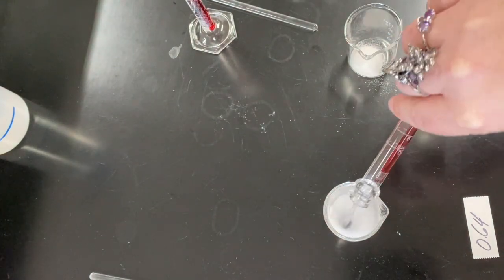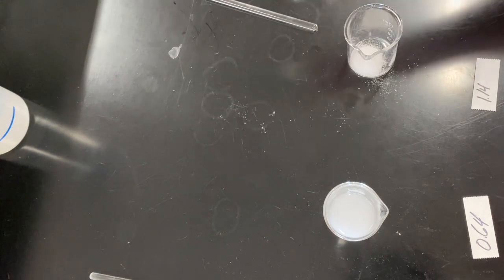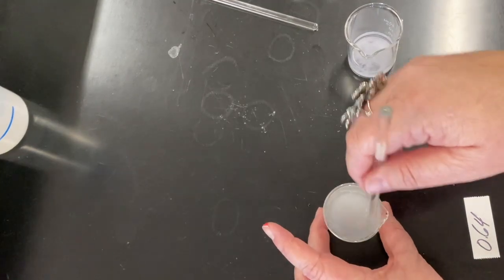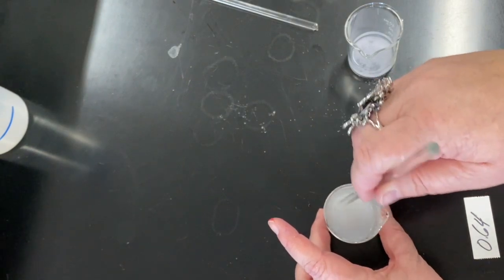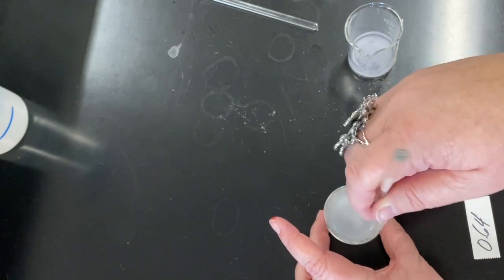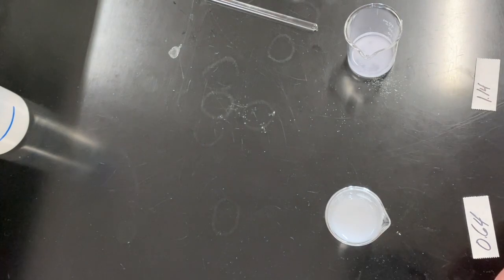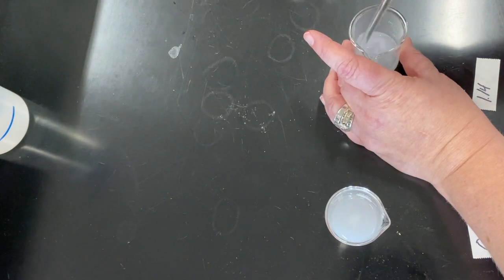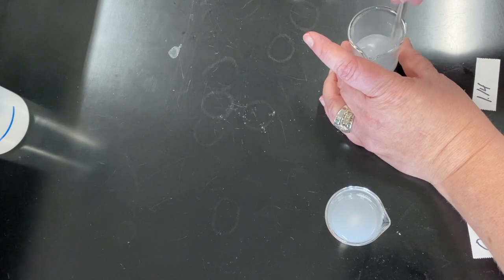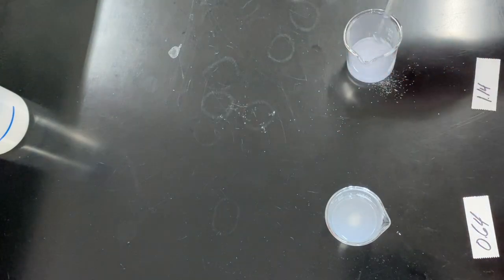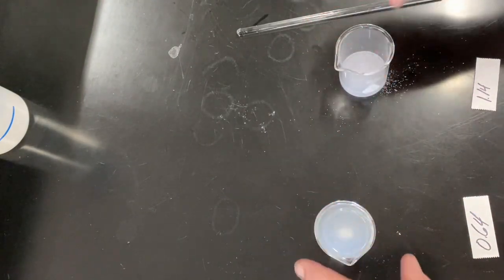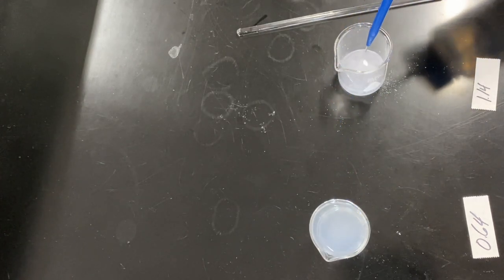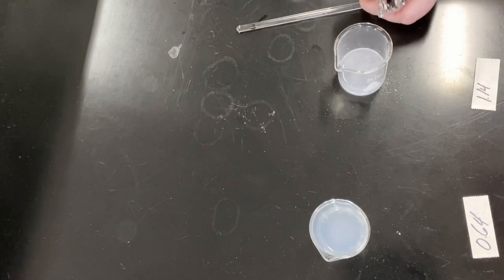Okay, we're going to add 10 mils of water to each to create what we call an aqueous solution. This allows us to more easily react the substances. It's a little bit hard for the solids to react when they're in solid form. So I'm stirring now, trying to make sure that we get everything dissolved. Since the amount of the water in the solution is irrelevant, I'm actually going to add just a little bit more, just to make sure that it's all going to dissolve. Add a little bit more water, stir that up again.